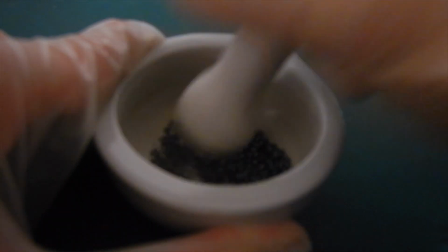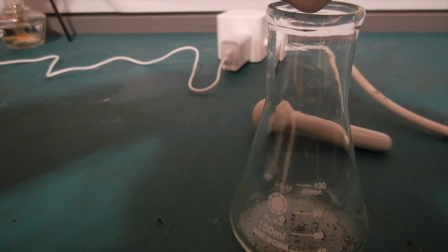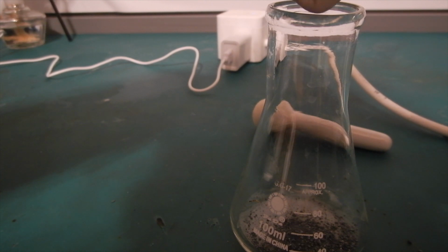Next, the iodine is ground into a powder using a pestle. I ended up not grinding it very fine because I wanted to be done as soon as possible. However, looking back, a fine powder will increase the reaction rate by a lot later on. I scraped the iodine off the mortar and scooped it into a 100 milliliter conical flask. Try to transfer as much of the iodine as possible since, well, it is not cheap.